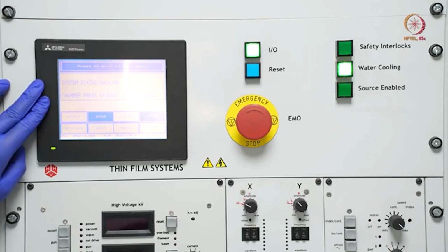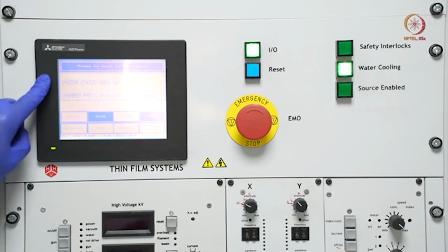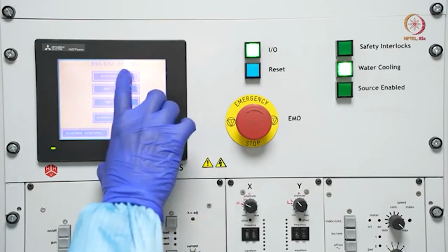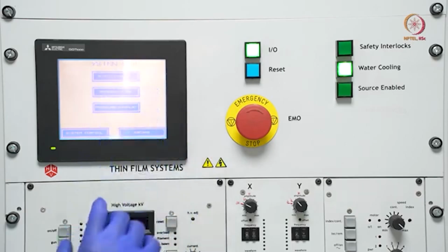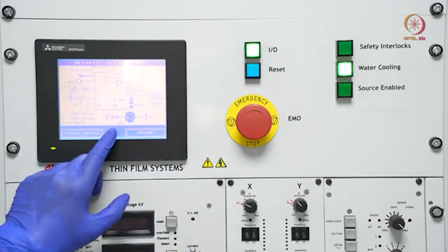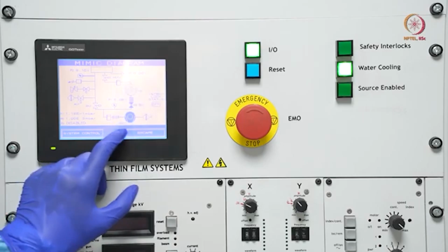After the backing pump started, it started the backing process. The backing process has two lines basically, which you can see from the system view and mimic diagram. Here you can see this is the rotary pump, acting as the backing pump now.